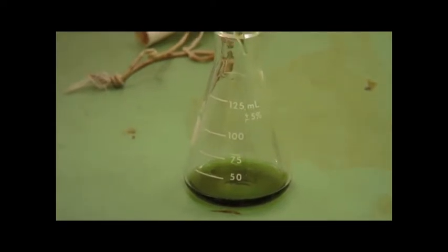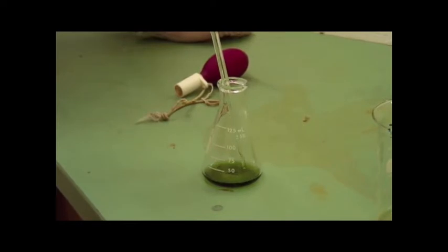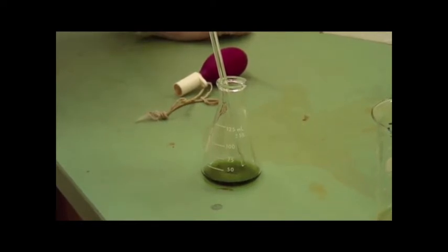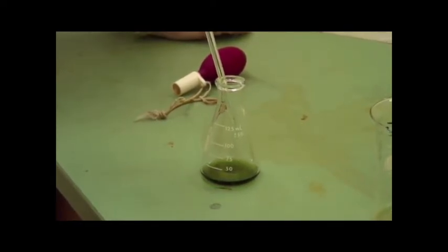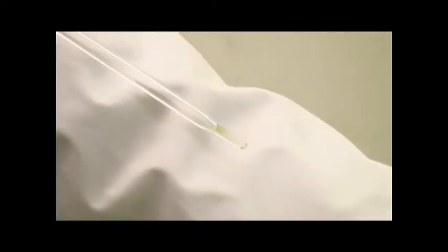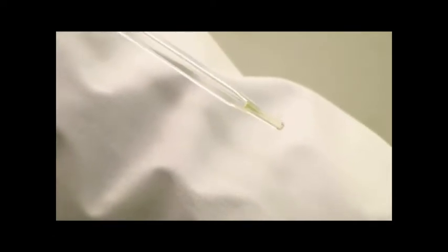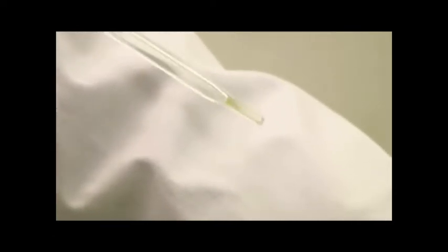There may well be a drip hanging on the end, so you touch the tip of the pipette to the liquid in the receiving vessel to break the surface tension and bring it out. Now you may notice I'm holding it up against my arm for color contrast. There is some liquid still in the tip of the pipette. Do not blow that out. The pipette is calibrated to retain that little driplet of water.